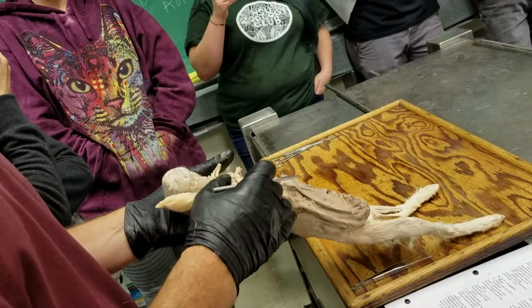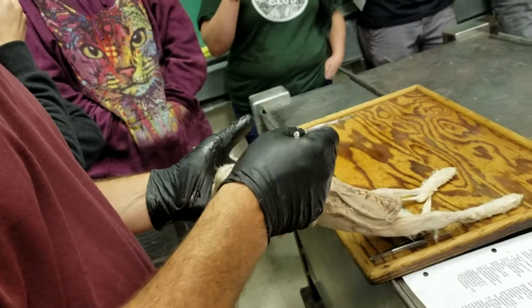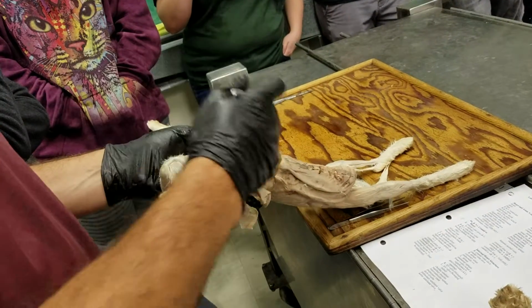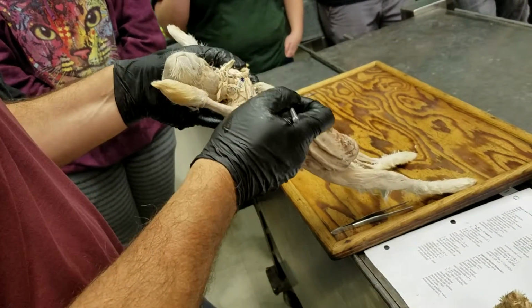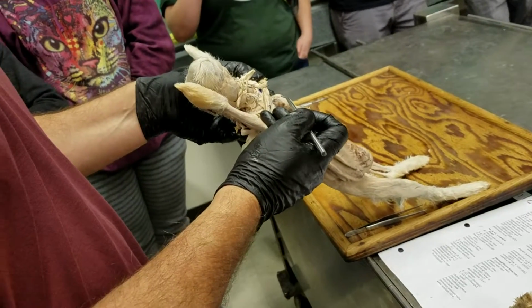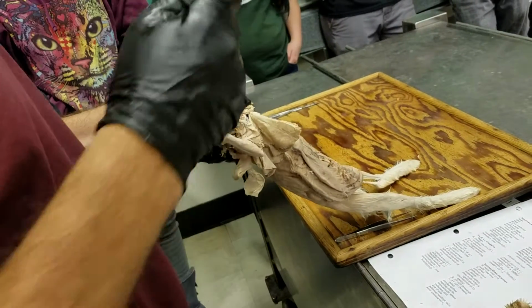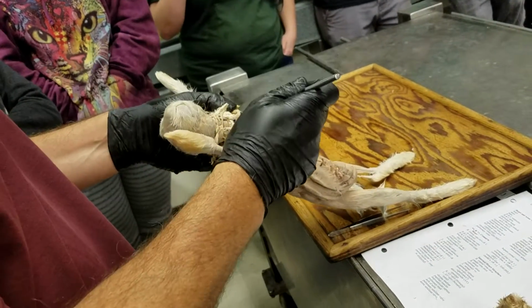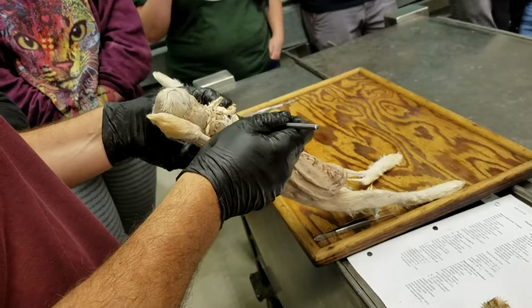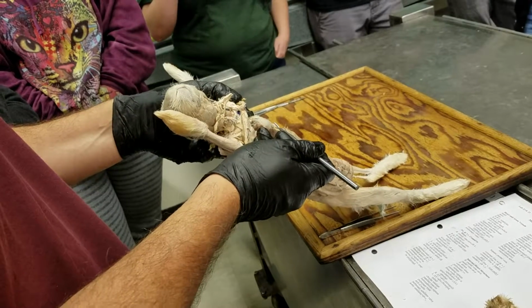So what I always do when I look at a heart, just to get oriented, is try to get it so I'm looking at the ventral side, because that's the way we normally look at them, because that's when you open up the animal, and find the right ventricle. And remember that the right side of the heart is the one dealing with deoxygenated blood. So it's getting the blood coming back from the body to the right atrium, right ventricle, and then it's going to send that deoxygenated blood to the lungs.